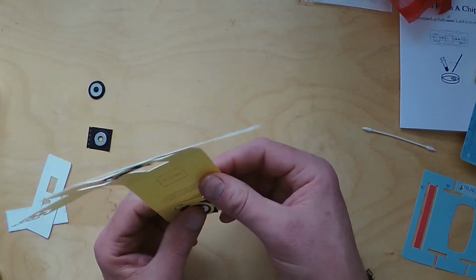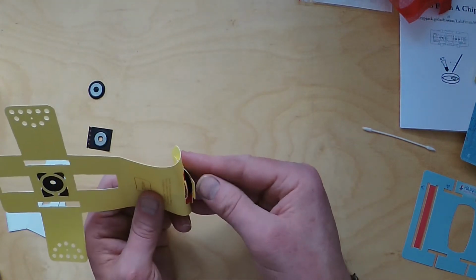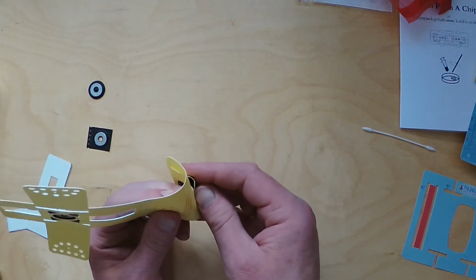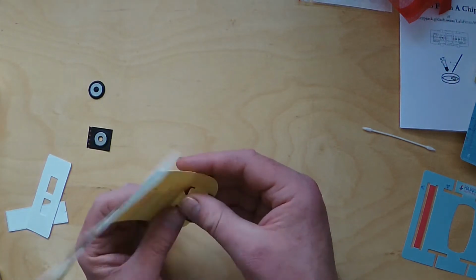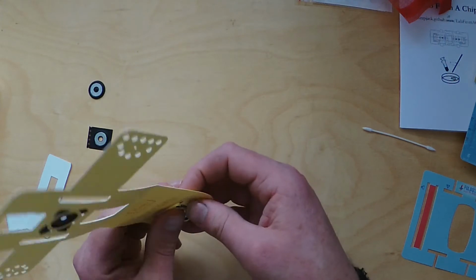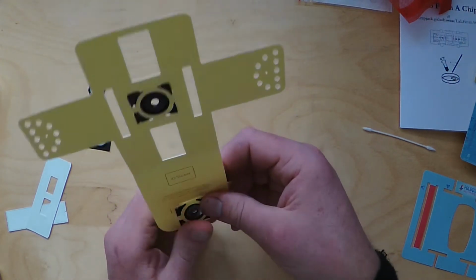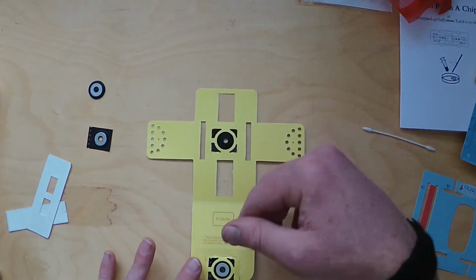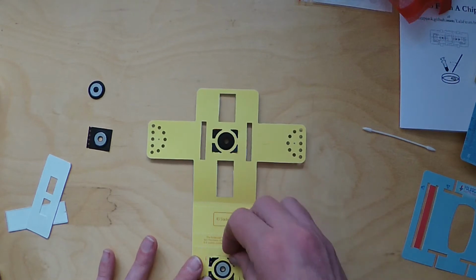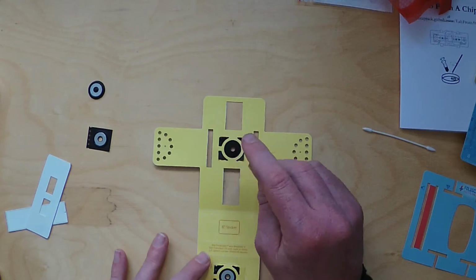It's not called origami microscope for nothing. There's a lot of folding. Let's get that there. Okay, this can be tricky. There you go. So that's folded up and locked in place there. So now the coupler will have its silver side showing up because you bent it over, and the silver side down at the top there.